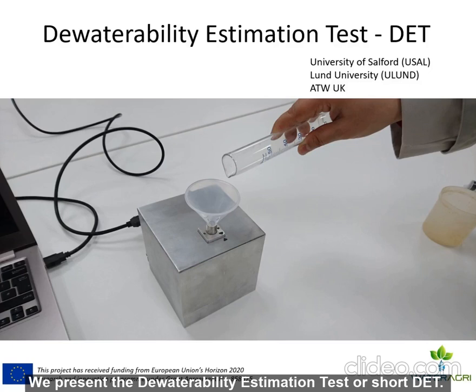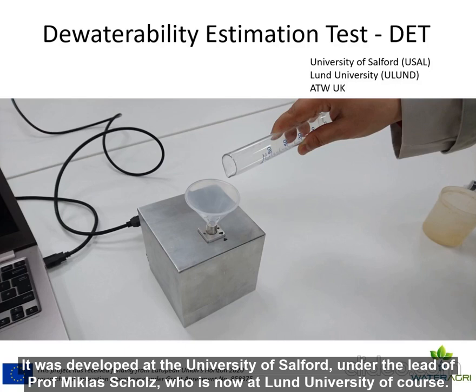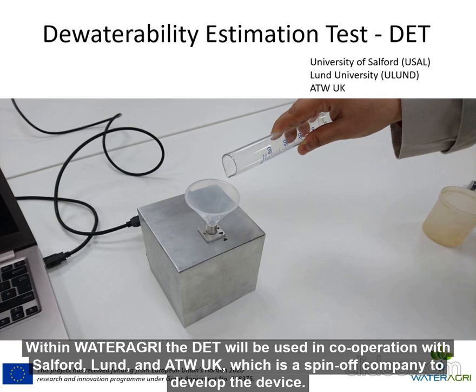We present the Dewaterability Estimation Test, or short DET. It was developed at the University of Salford under the lead of Professor Miklas Scholz, who is now at Lund University. Within Water Agri, the DET will be used in cooperation with Salford, Lund, and ATW UK, which is a spin-off company to develop the device.